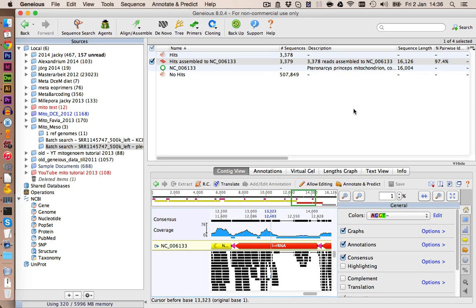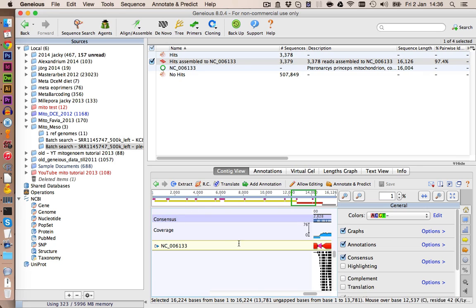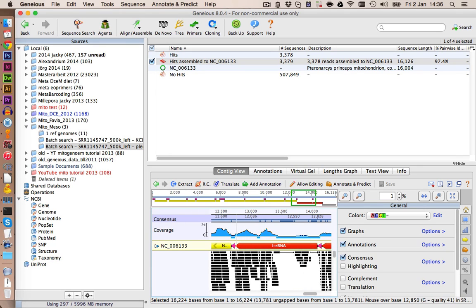What we are going to do now is we select the consensus sequence, and we're just going to export this consensus. So the consensus is basically all our mapped reads and kind of a summary. And we're now going to use this consensus as our first draft genome, and we add it to our database to map the remaining reads, the no hits here, against this consensus. We can expect that we find some more hits because the consensus resembles the real mitochondrial genome much closer, and most hits will have a 100% or close to 100% match to this draft genome.